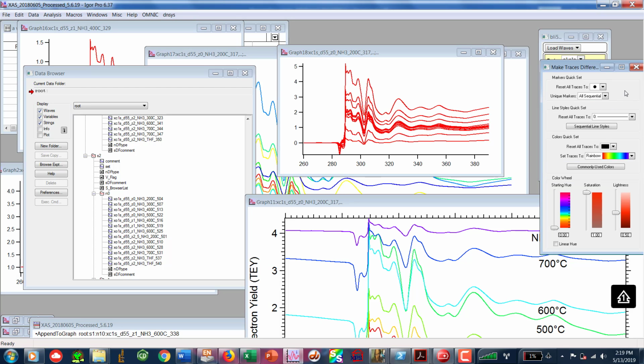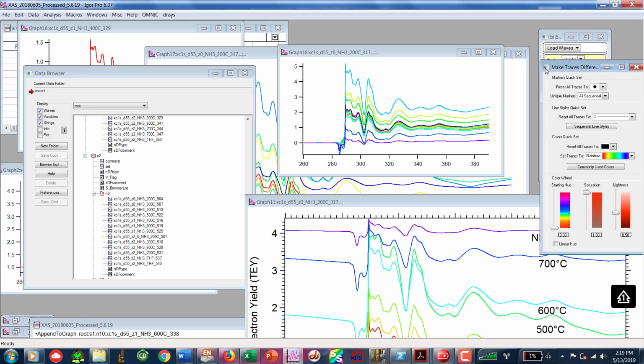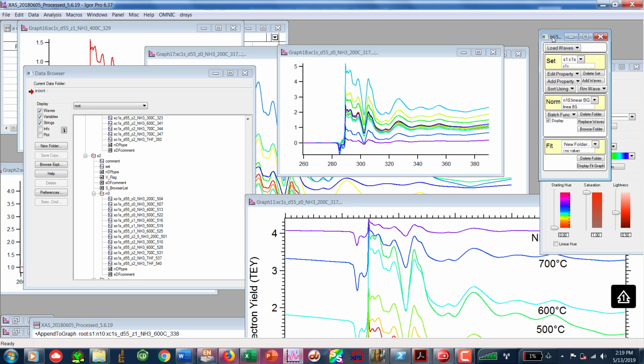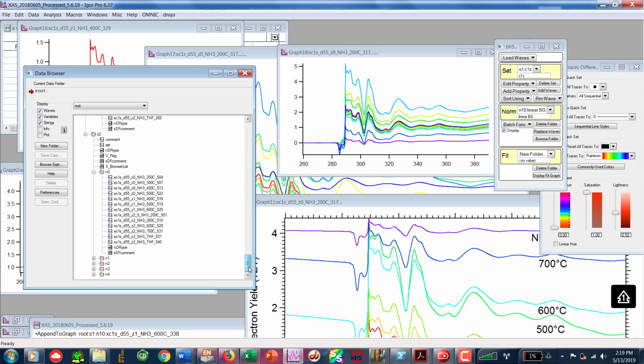You'll notice that from 260 to 280, it looks pretty good. I have not done the atomic normalization, and I just want to show you quickly what I did, and you can kind of take it as a possible route that we can do to get this thing up on its feet. Now what I did is I only did the work on a very small subset of data.